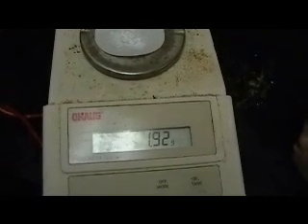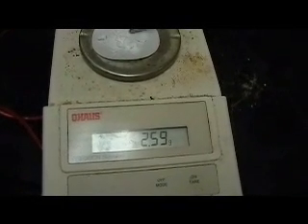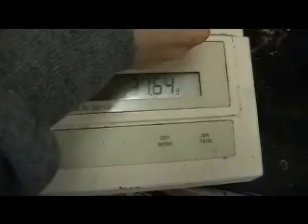Then mass approximately 2.36 grams of sodium bicarbonate, also known as baking soda, which amounts to about half a teaspoon, a little bit more. It does not have to be exact, but approximately 2.36. After massing the baking soda, the sodium bicarbonate, put it into the test tube.